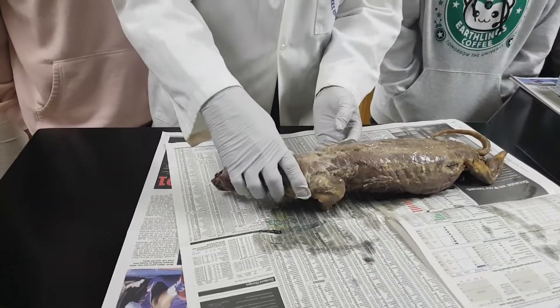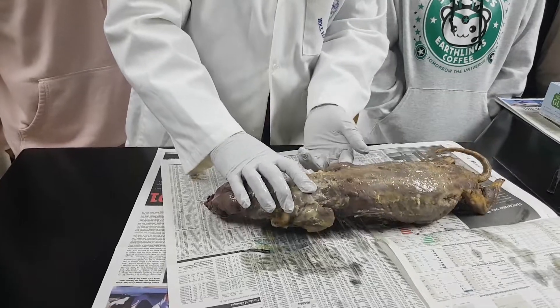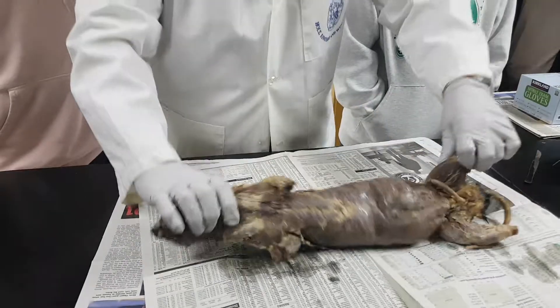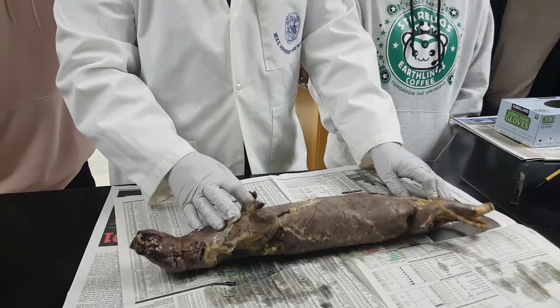What we did is we dissected out muscles. You see this is the latissimus dorsi — it's on both sides. There are a bunch of others but I'm not going to show them to you. We'll get into the good stuff.